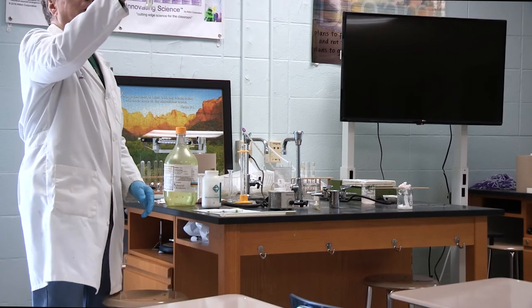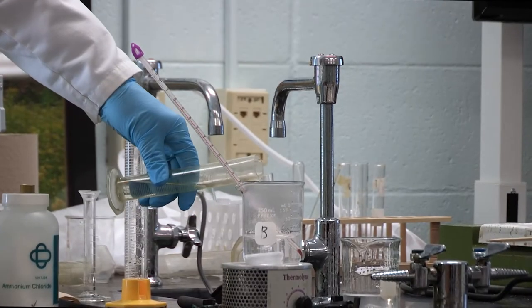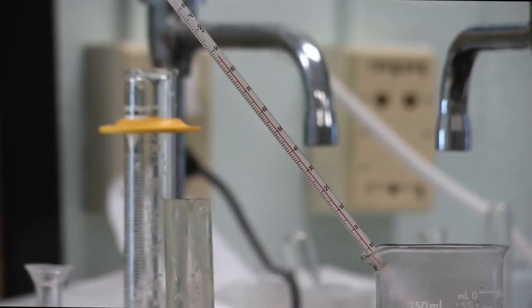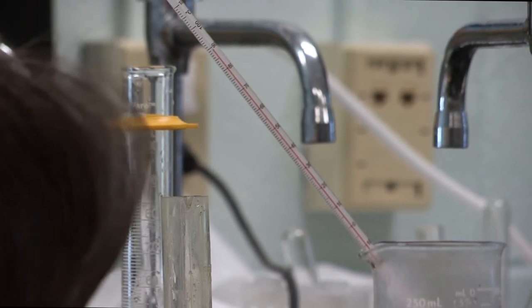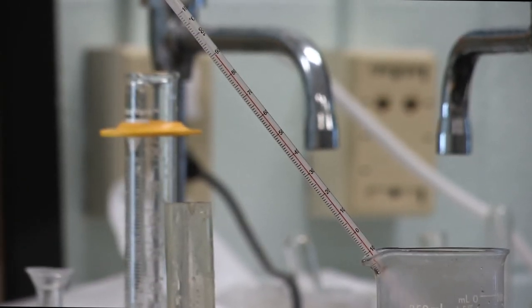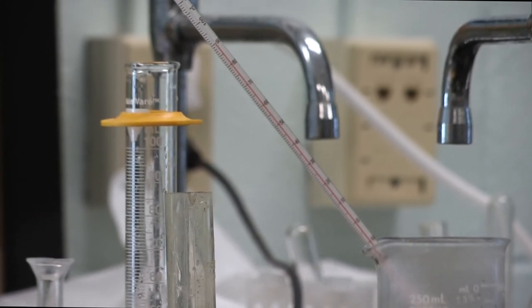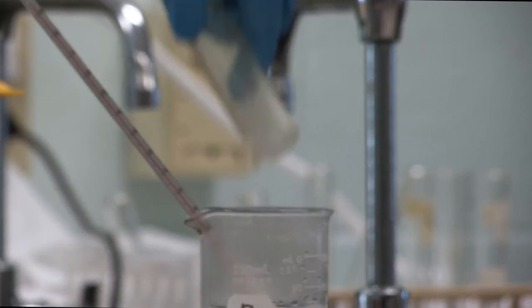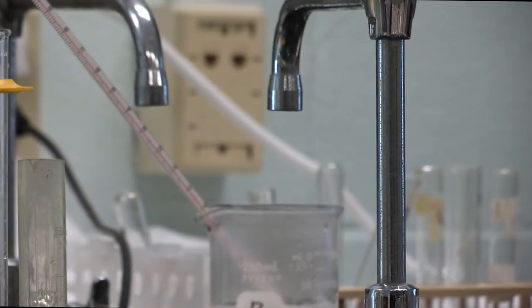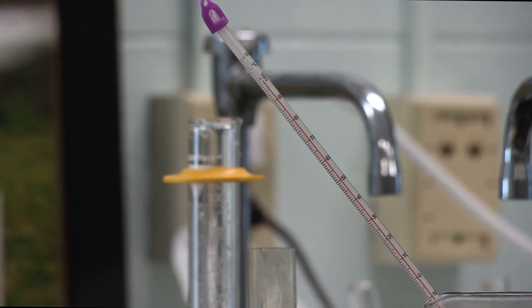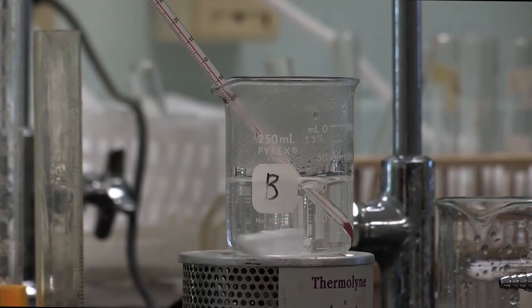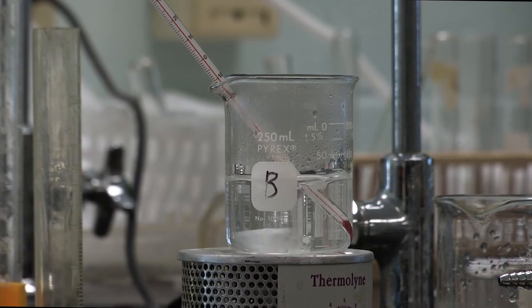Let's just go ahead and add the rest. I've got 20. So I'll add 10 more. Let's see what happens if we add 10 more milliliters of the straight acid. It looks to me like it's up to 89. So that only took us up another 6 degrees. Let's go ahead. We've got about 11 milliliters left. Let's pour the rest. What I'm actually making is a one-to-one water and sulfuric acid solution. Did it make 100? Oh, not quite. I got 99. We went from 14 to 99 degrees. So we've gone up 85 degrees.